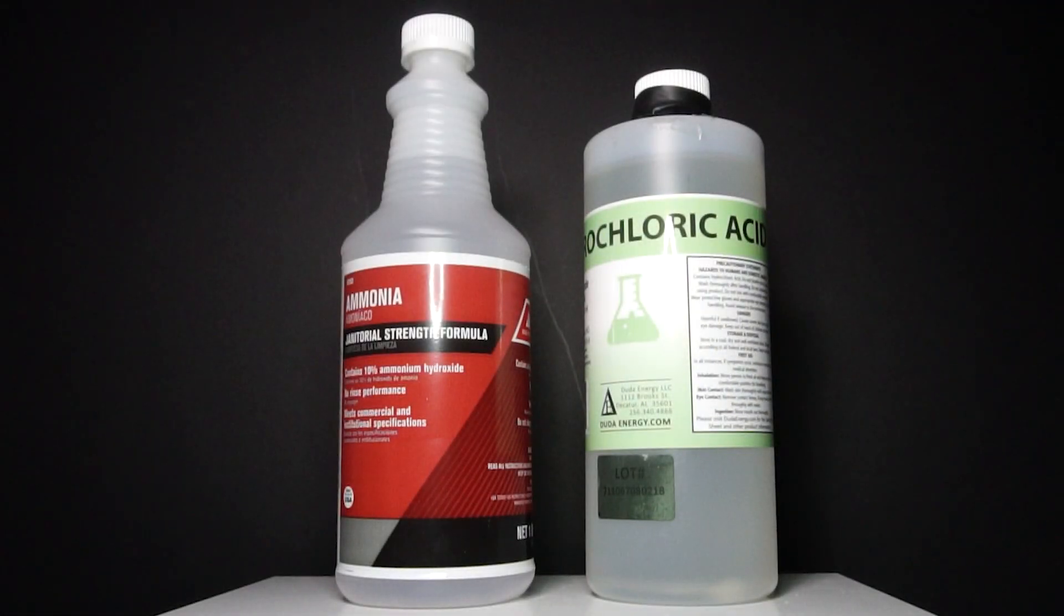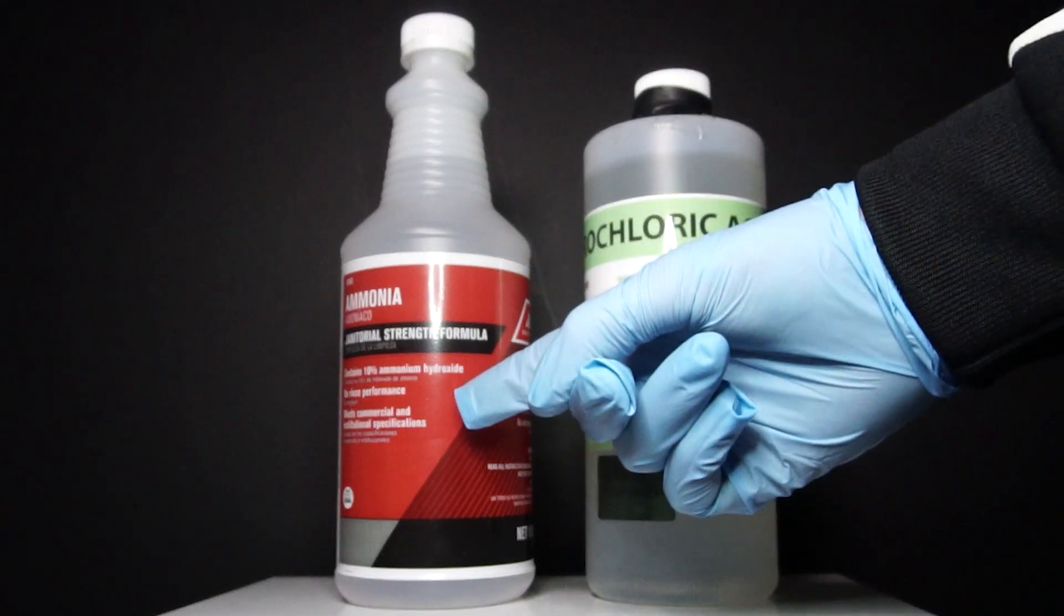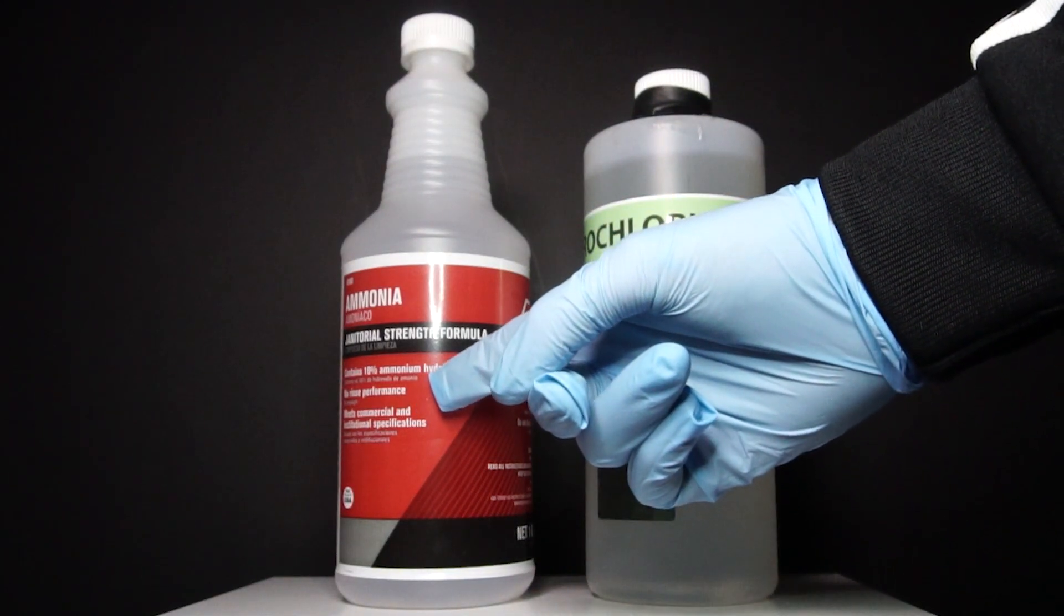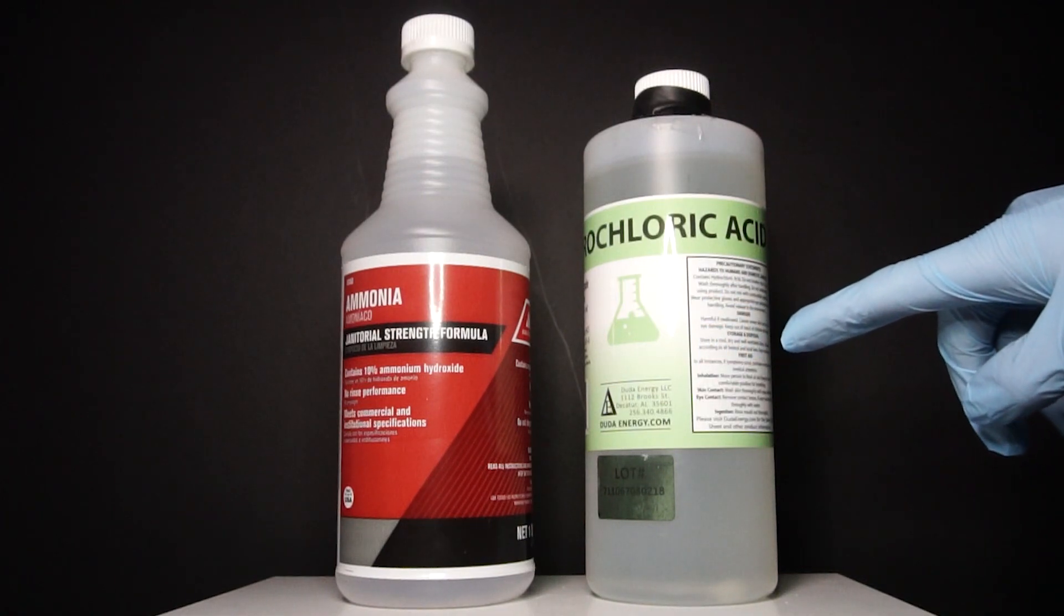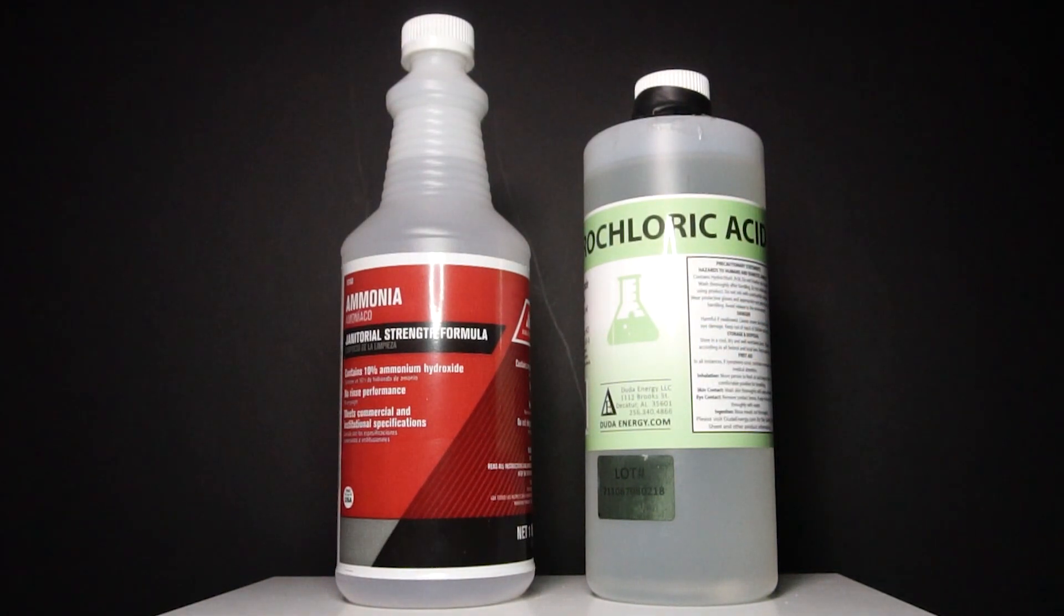The only two chemicals I will need are ammonia at at least 5% or ammonium hydroxide at 10% - I bought mine at the local hardware store as janitor grade ammonia - and some hydrochloric acid which can usually be found in pool stores.